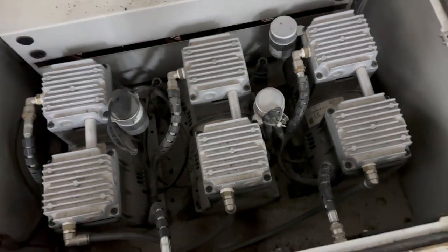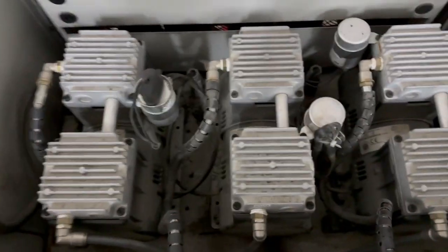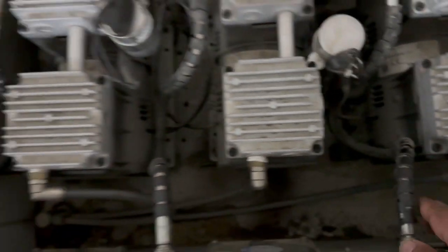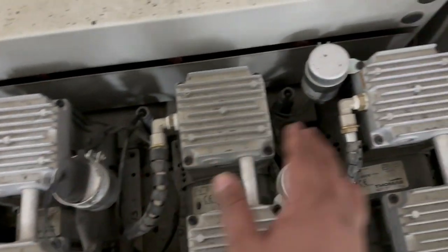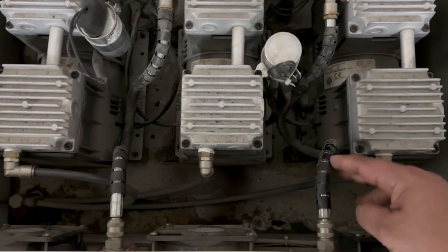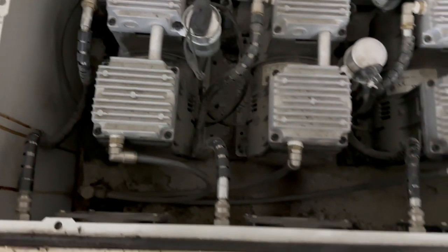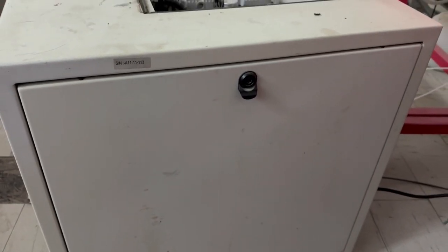We will troubleshoot this. So here we have 3 compressors which compress the air, and then output 1, output 2, output 3. Okay, so suction port 1, suction port 2, suction port 3. So 3 diaphragm pumps used as a compressor, and it compresses the air here, and then it goes in this way. So first we have to open this, and then I'll show you how it works.